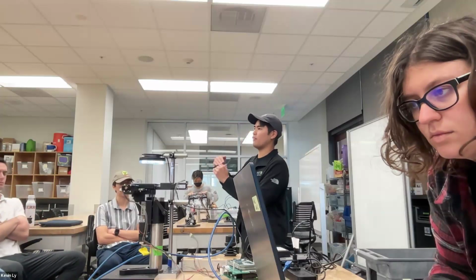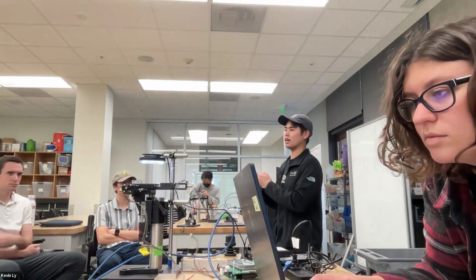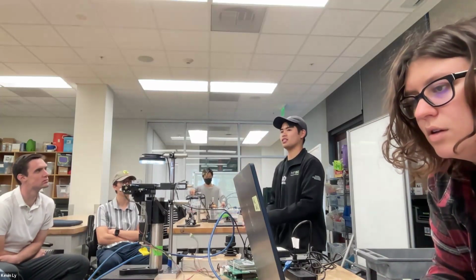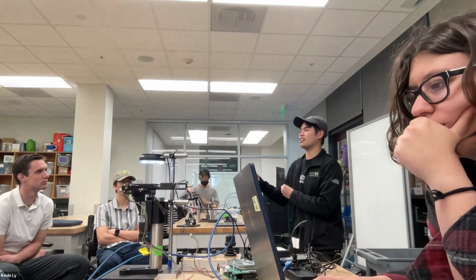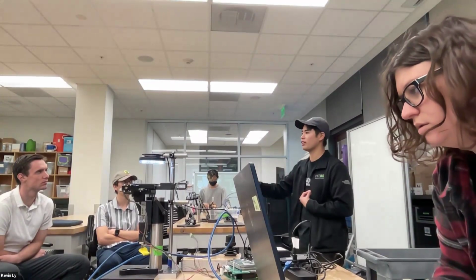So it provides a level of abstraction, so the programmer can do what they need to do without worrying about the hardware level detail. So that's what a driver is. They are your friends. You think about drivers when you say, this is a cool piece of hardware, I want to control it with software, I need to find a driver.